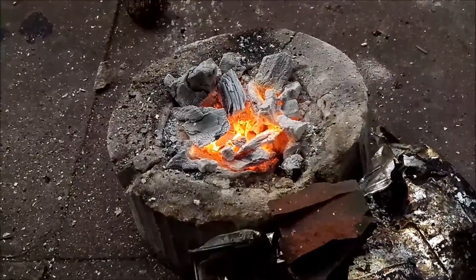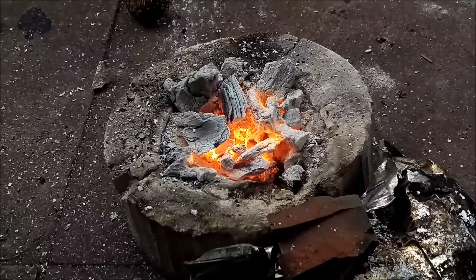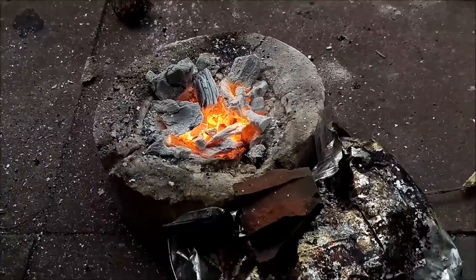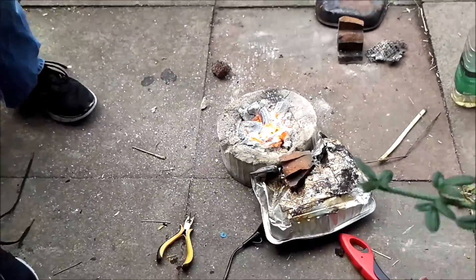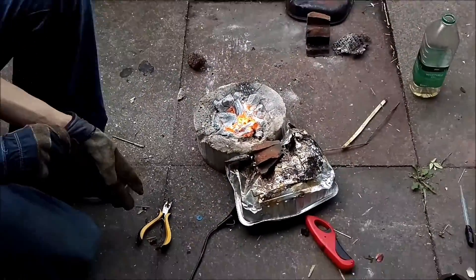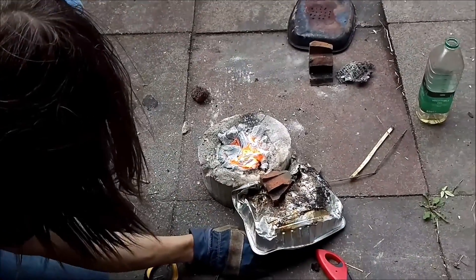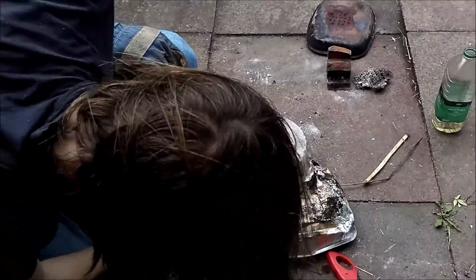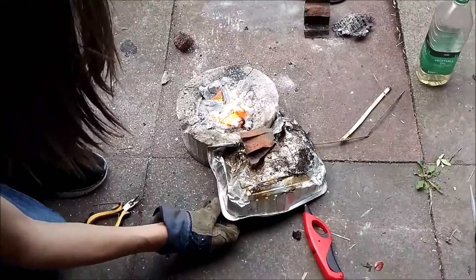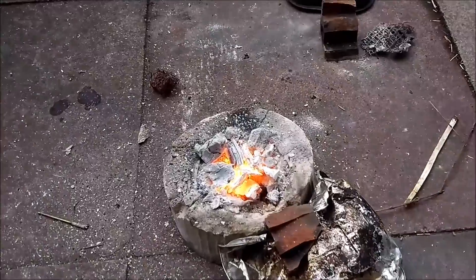It is glowing rather orange — that looks very good. Still looks fairly solid. We're going to crank up the hairdryer even more and see if we can make it any hotter. This is where you put gloves on and stand back and really hope it doesn't fall over. It's still in one piece — that's good. Might be getting a bit of coal in it though. We'll leave it like this and get back.